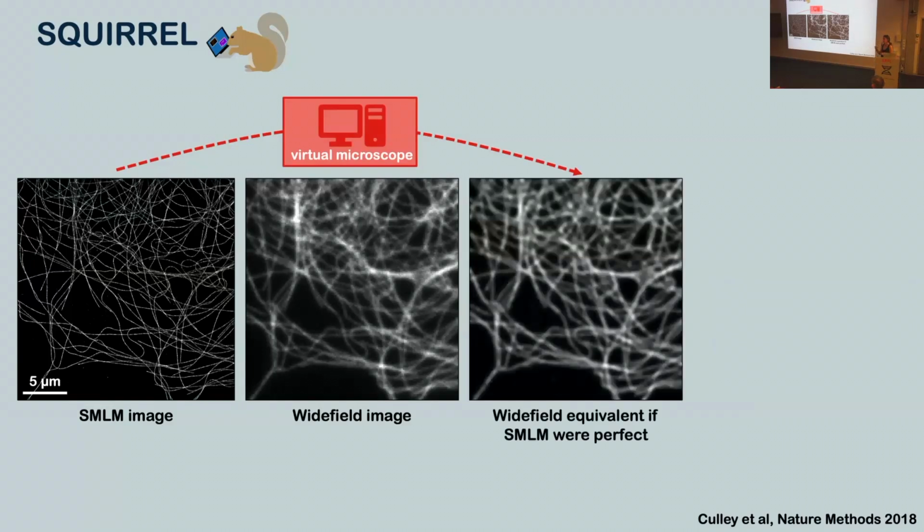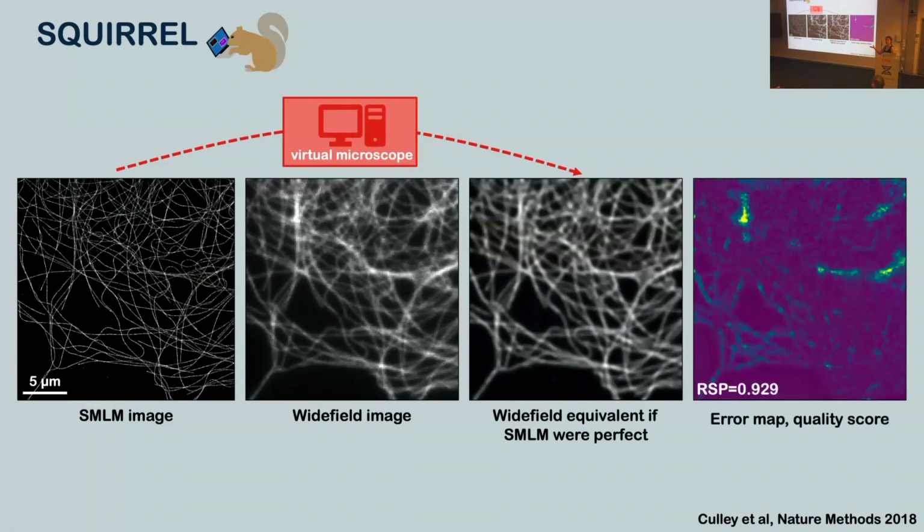Now, spoiler alert, it probably isn't perfect. And the way that we can assay that is literally by comparing it with our wide field image. So we can create an error map. The yellow areas are kind of danger zones where there's a mismatch between our blurred single molecule image and our wide field image. And we can also get a quality score. This is just the resolution scaled Pearson's correlation coefficient between our true wide field and our simulated wide field.